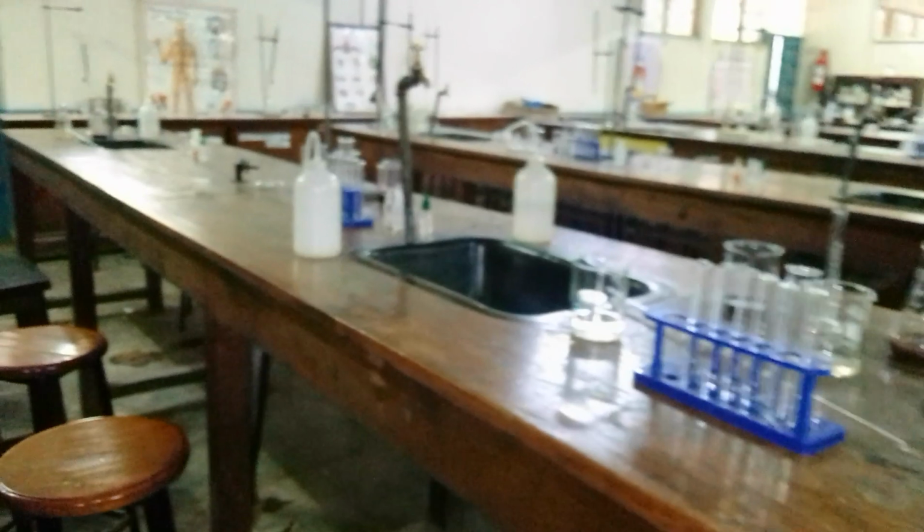We have explained as far as the wash bottles are concerned.